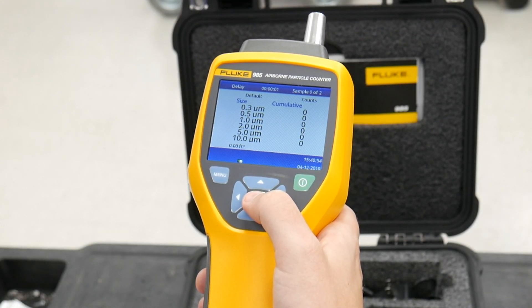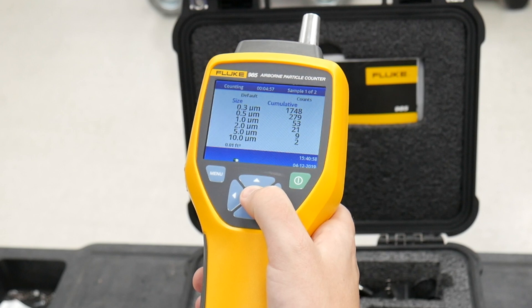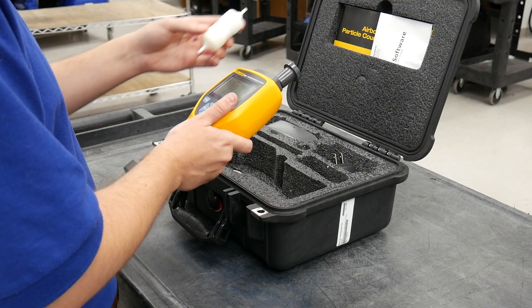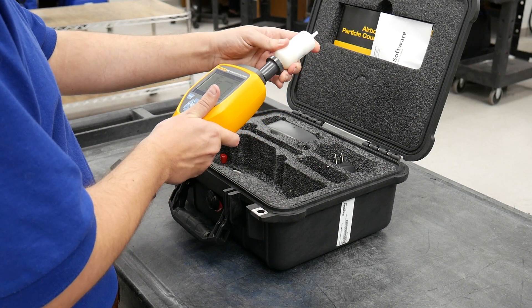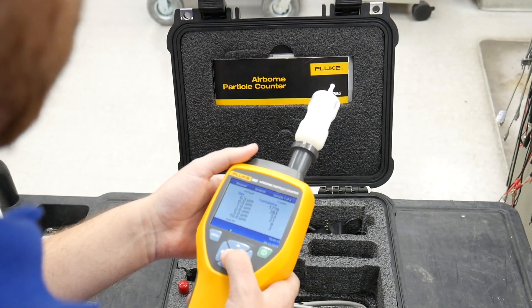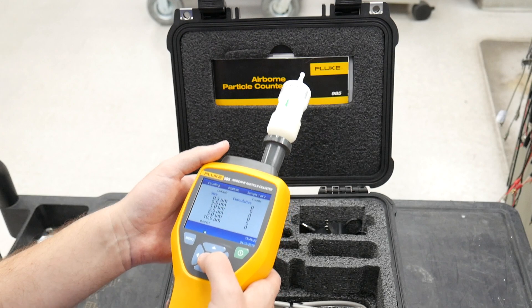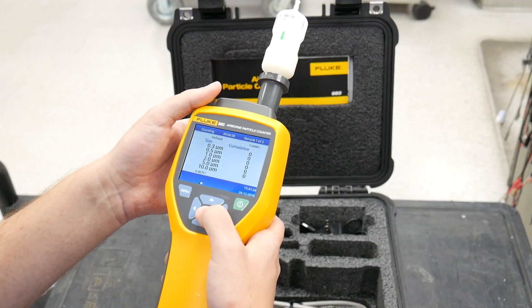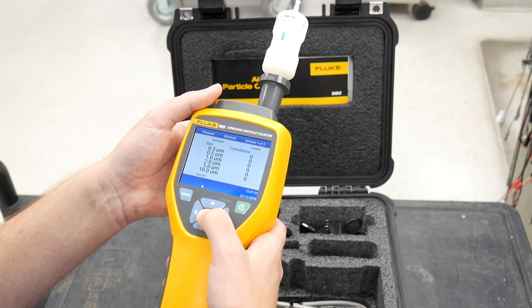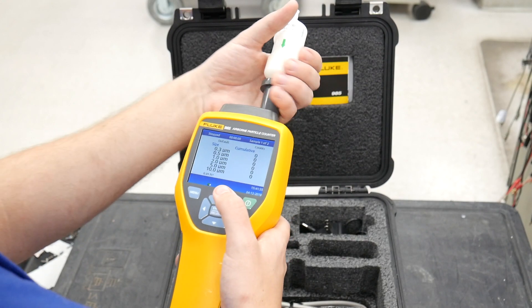Here you can see the particle count currently that the machine is reading. What you can do to get a baseline reading is affix our zero count filter to the Fluke 985, and this should give us a reading of zero particles. Let's press enter and begin the count — you can see it's doing its three second delay, and then it's counting. It's set to a five minute cycle, but as you can tell, we're getting nothing here, which is perfect because that's what the zero count filter is designed for.